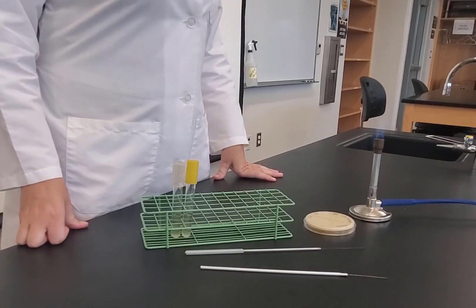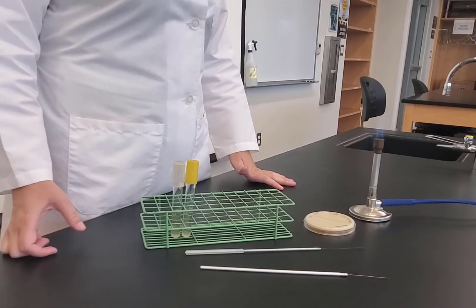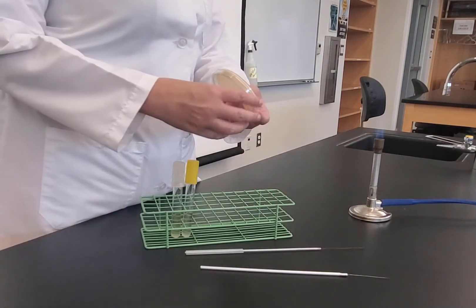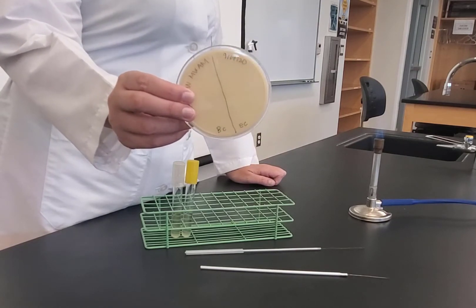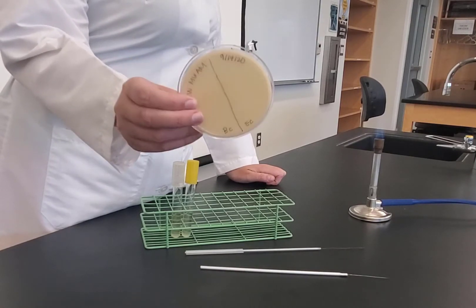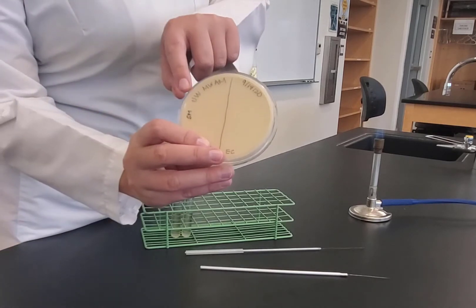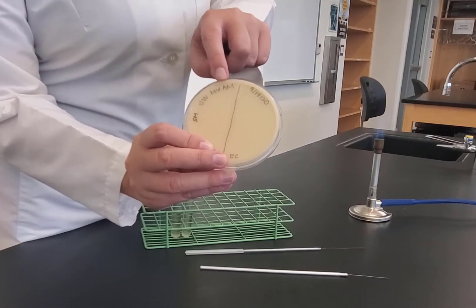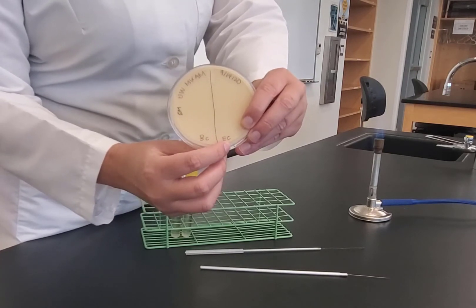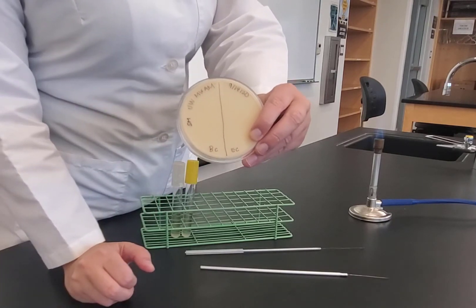In this experiment we're doing a casein hydrolysis test. The purpose is to determine if bacteria can metabolize casein — a big, bulky milk protein. We have a skim milk agar plate, which is cloudy white because the casein protein is intact. The plate is labeled with initials, lab section, date, and two organisms: BC for B. cereus and EC for E. coli, with a line drawn down the middle.